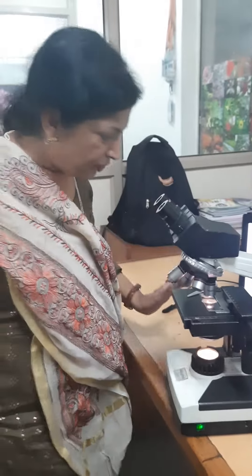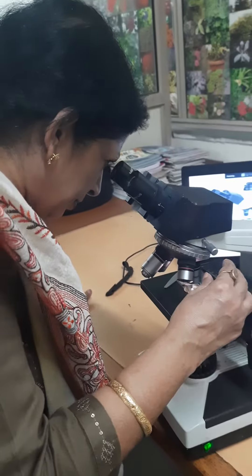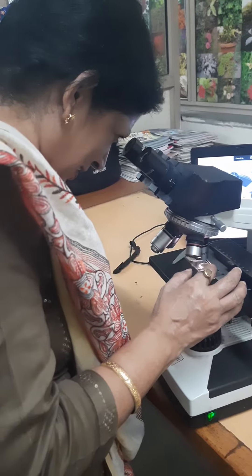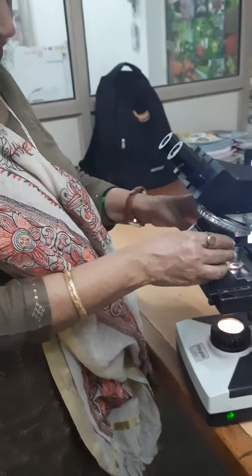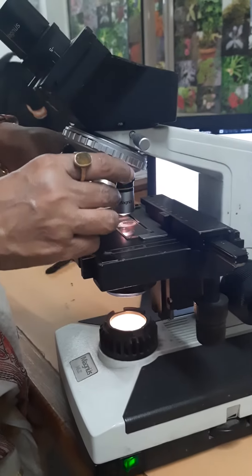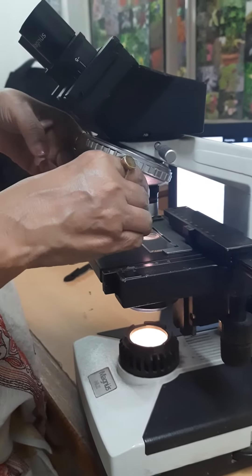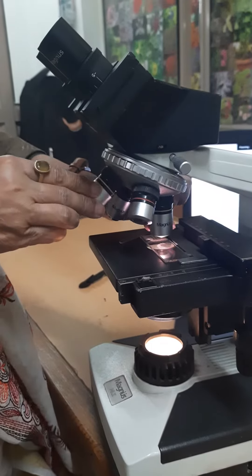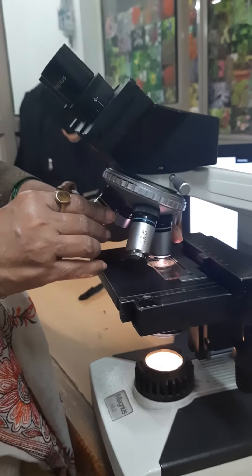So when you place a specimen here, you can change the magnification as needed. You can place the 4x objective, then move to 10x, then 40x, and then 100x.